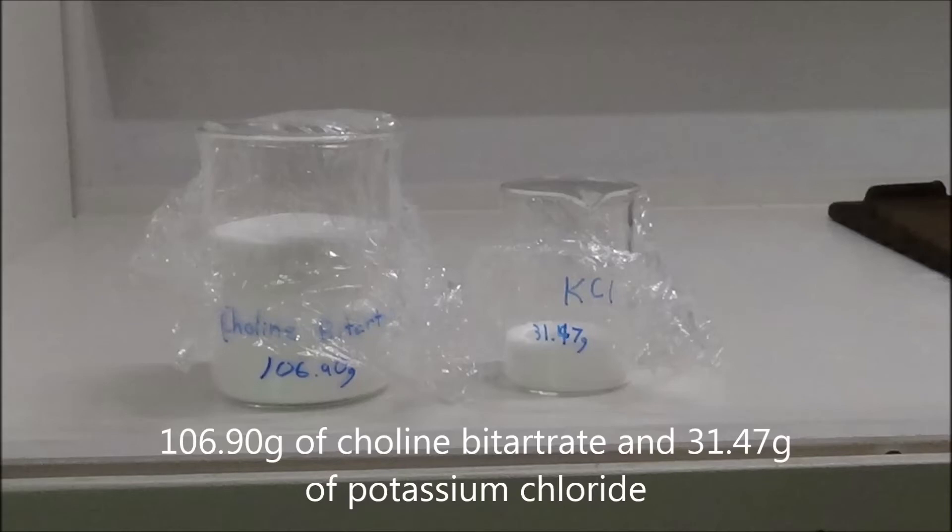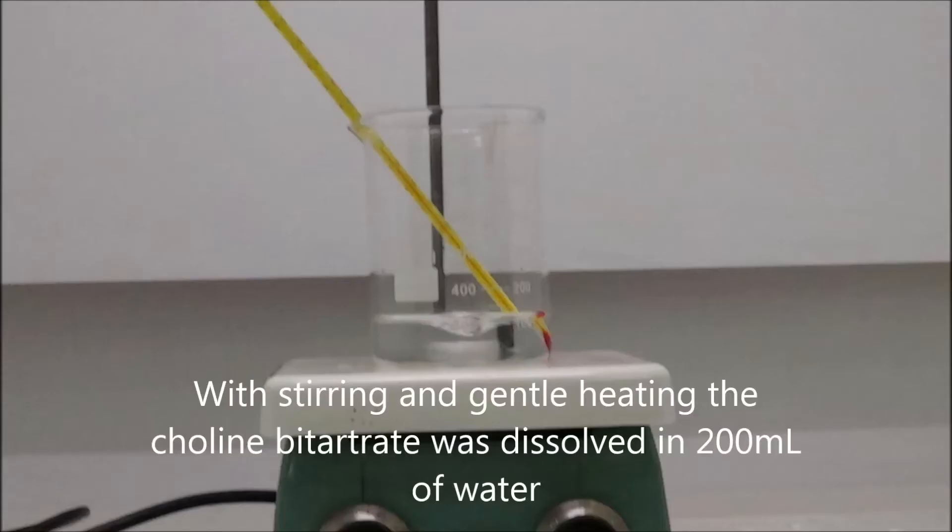The two reactants were weighed out in equimolar amounts. Next, they were both dissolved in water.